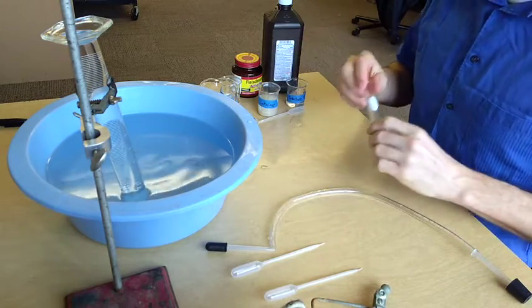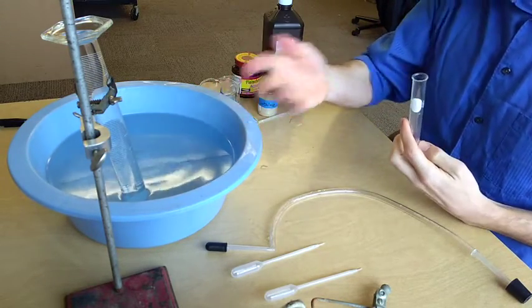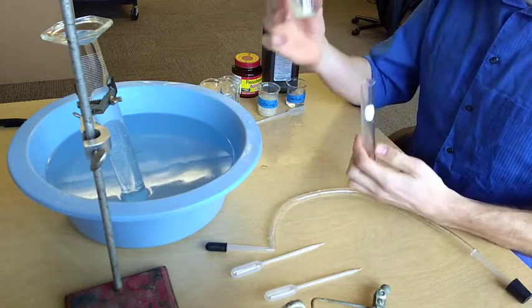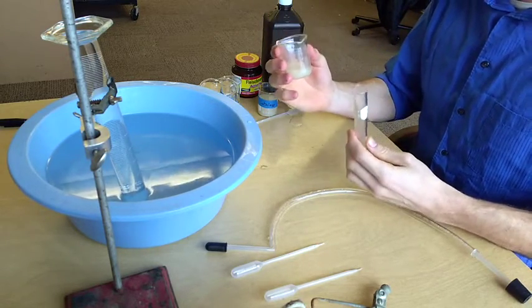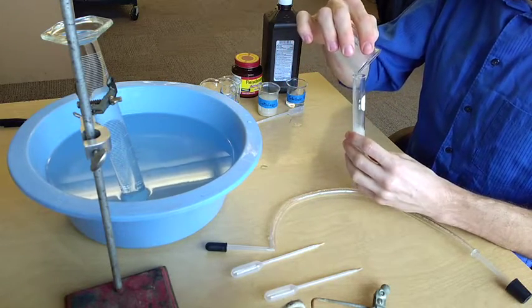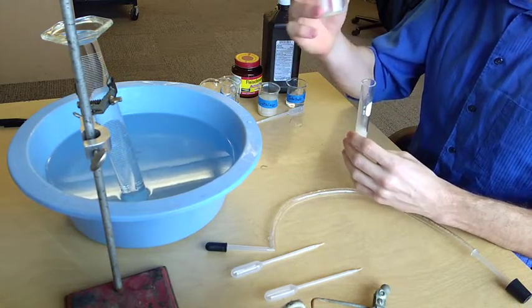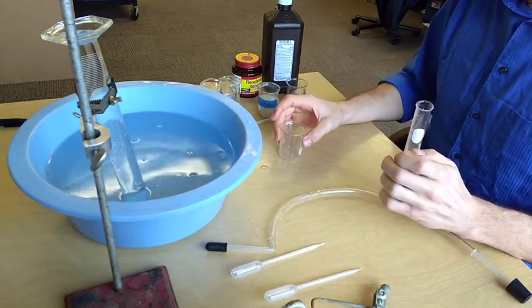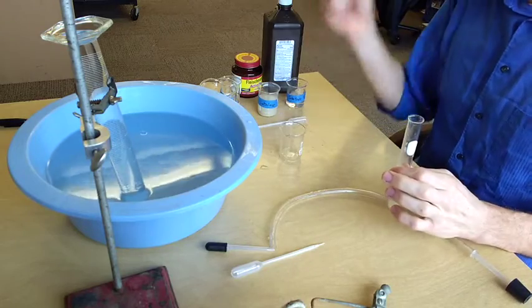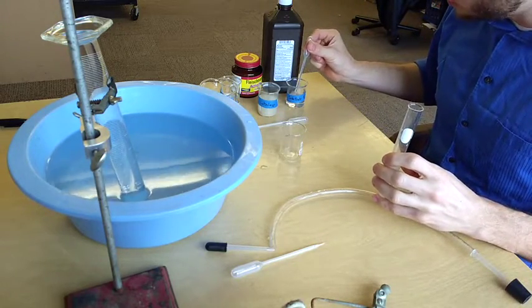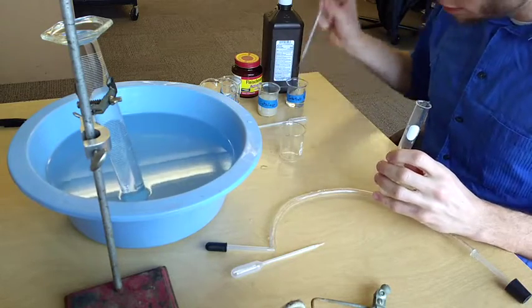Now I'll show you how to set this up and watch the lab run pretty quickly. So I'm going to take my 10 milliliters of catalase extract, insert it into my test tube. I can then rinse this out. Now that it's clean, I can use the same container. Using a new pipette, I can use three milliliters of my hydrogen peroxide.